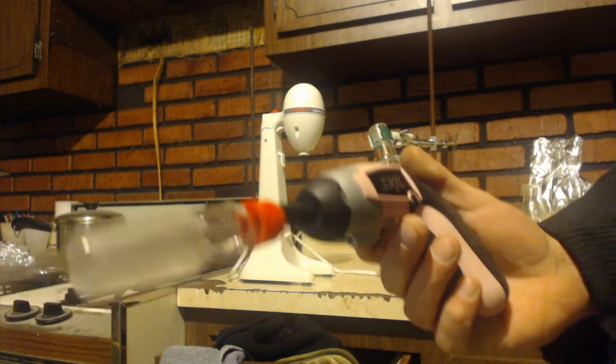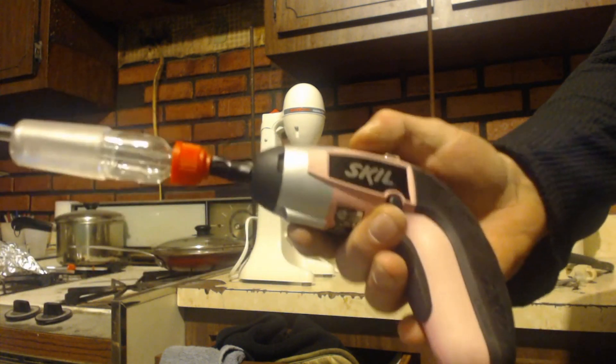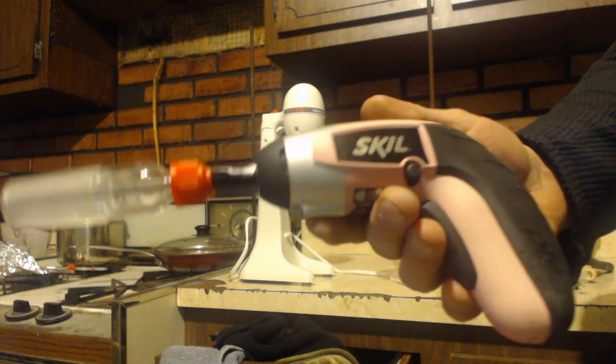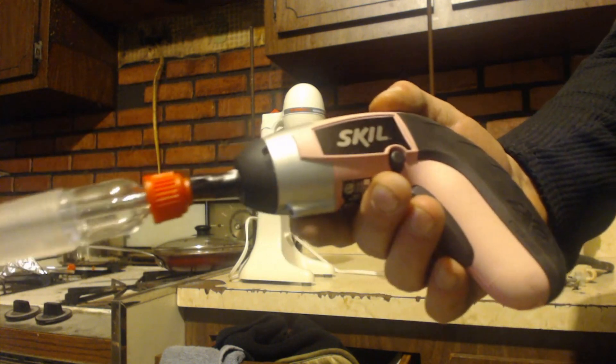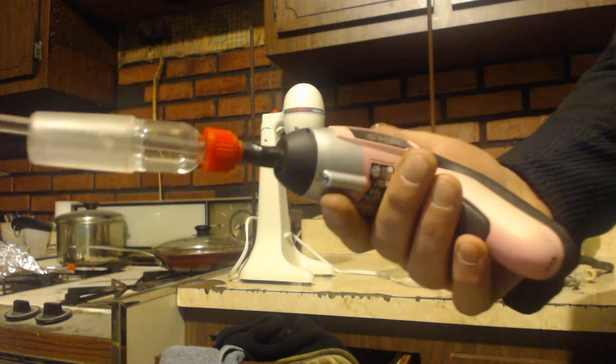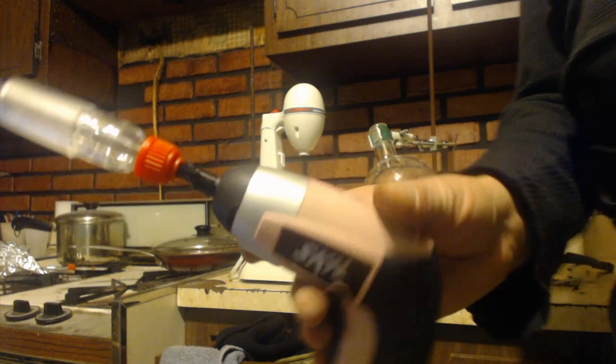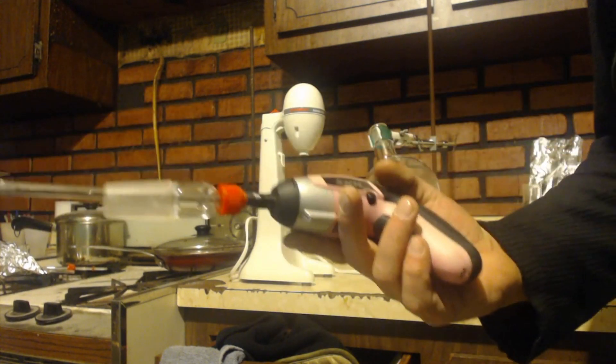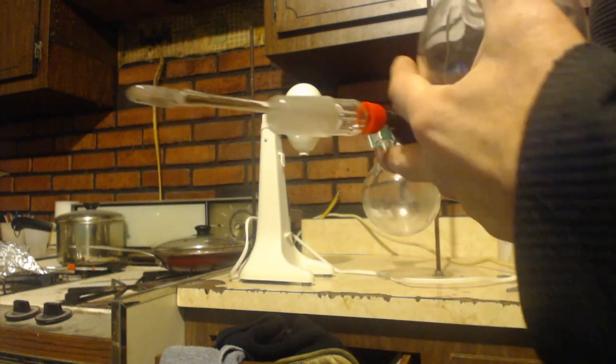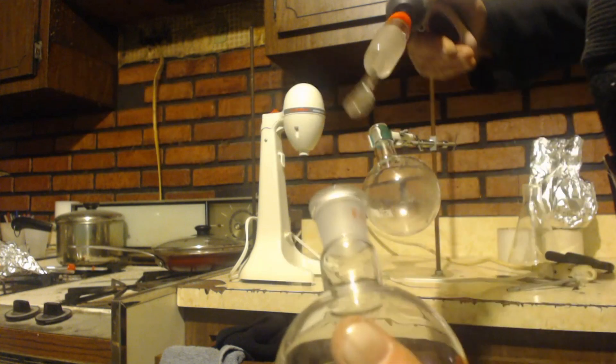If you buy it you're going to throw it away because it's garbage. I've never used it but I know it won't unscrew anything. But check this out.